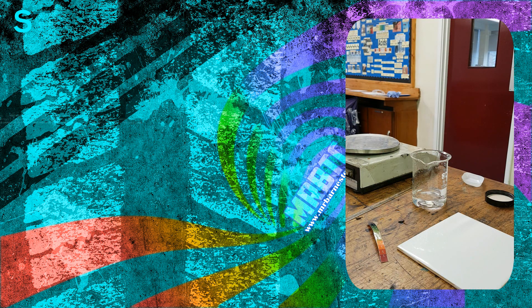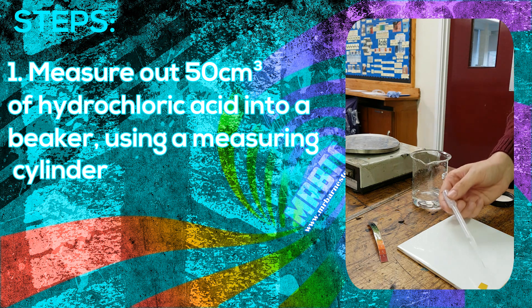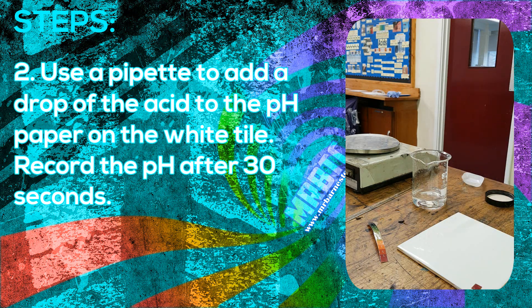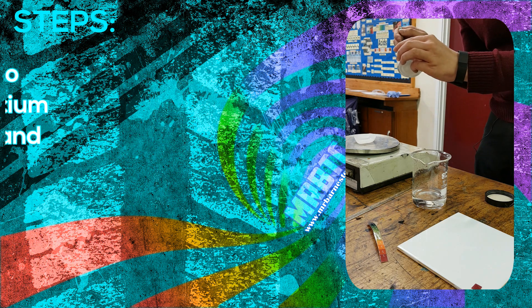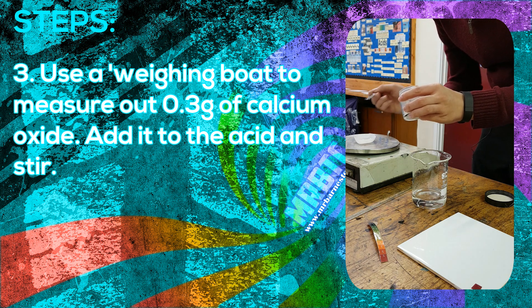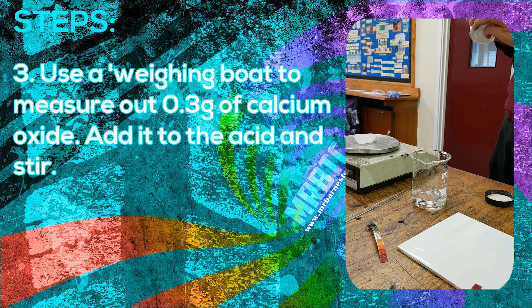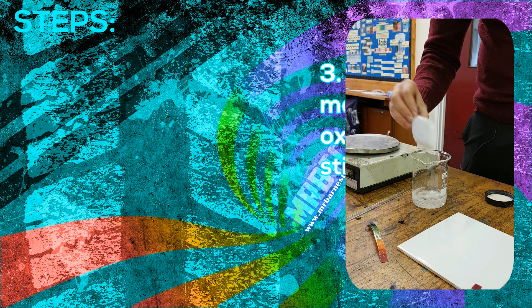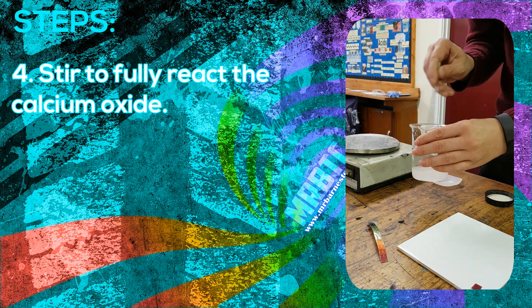To carry out this investigation, first use a measuring cylinder to measure out 50 centimetres cubed of hydrochloric acid and put it into your beaker. Then take some of that acid and put it onto your pH paper on your white tile. Leave it for 30 seconds and then figure out the pH. Once you've done that, use a weighing boat to measure out 0.3 grams of your calcium oxide, then add it to your hydrochloric acid. Once the calcium oxide has been added, stir it to make sure it's fully reacted.